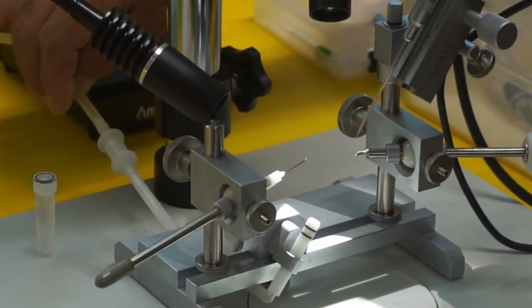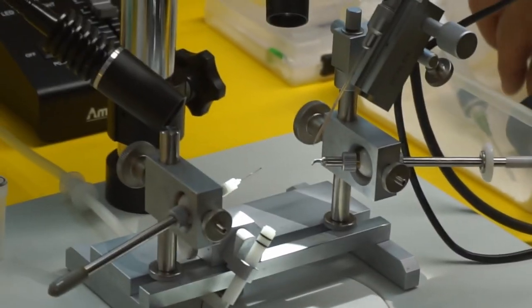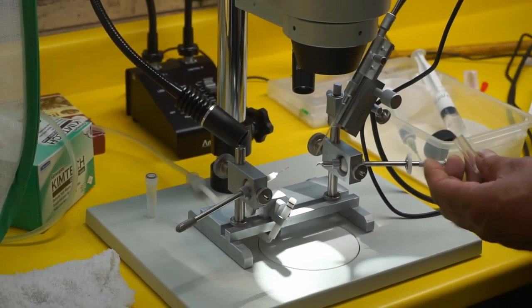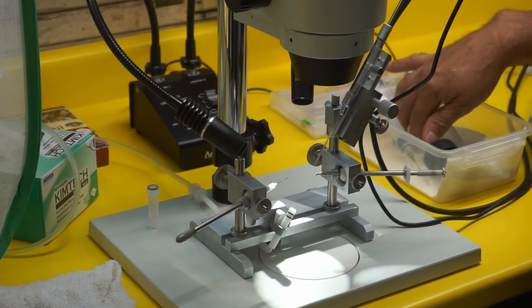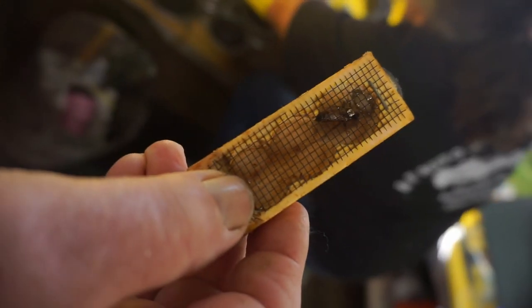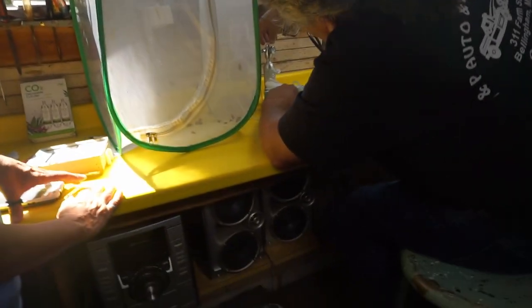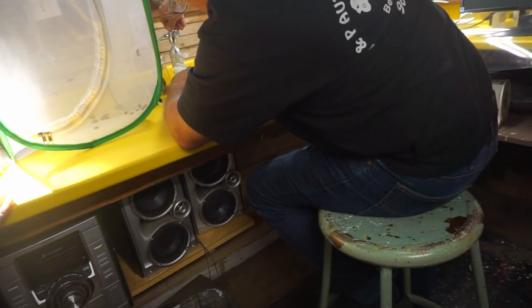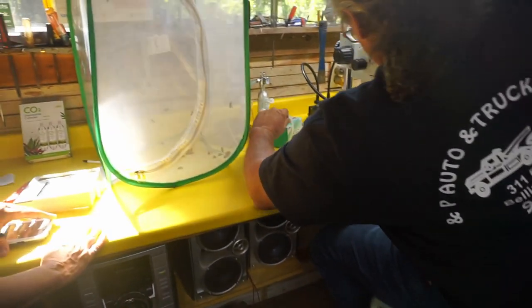So this is hooked up to CO2. I cleaned these earlier. All right, here's our virgin. I'll call it Brockton by the sea. Very good. So she's going on five and a half days old, six days.